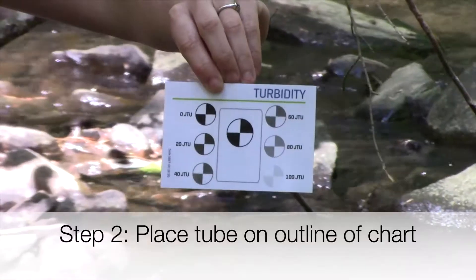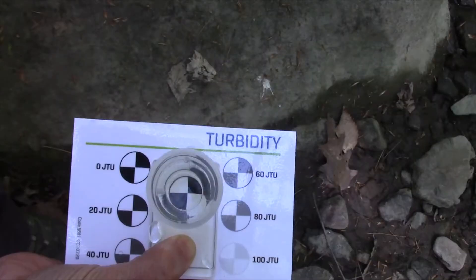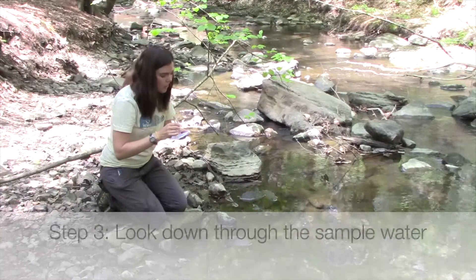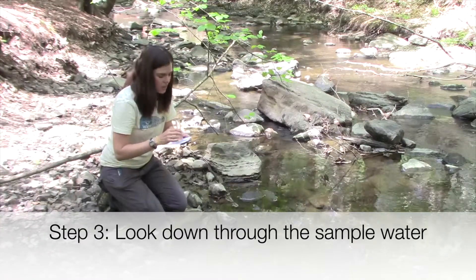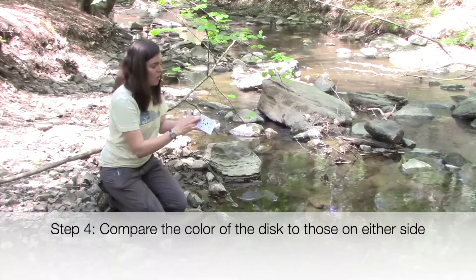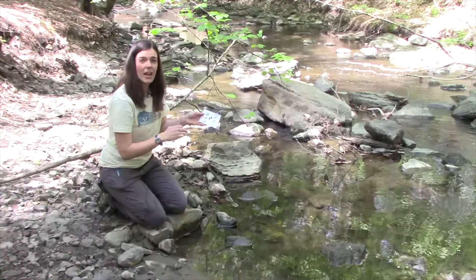Take the tube and place it in the rectangle on the sheet so that the black and white circle is lined up with the bottom of the tube. From here, look down the tube — maybe with just one eye open, one eye closed — and compare the color of that black and white circle with the images found on the outsides.